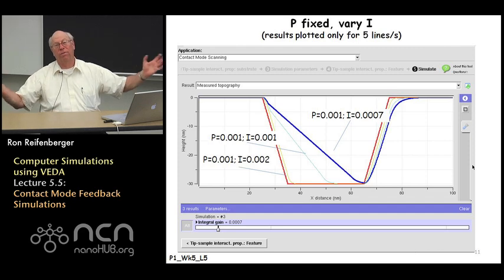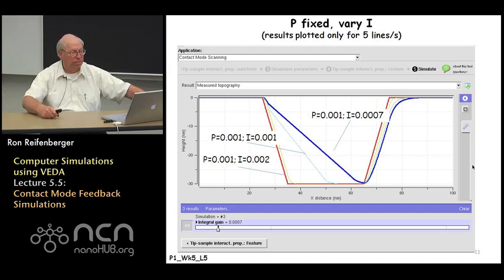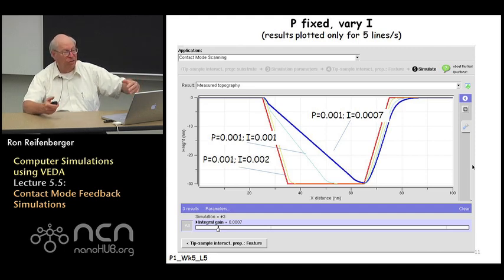On the other hand, if your proportional and integral gains are set completely wrong, the case for the solid blue line in this slide, again, you're going to misinterpret the geometry of the feature. Your AFM image would not even come close to reproducing that trapezoidal topography. So again, this is something that you have to worry about. You have to systematically adjust these parameters.